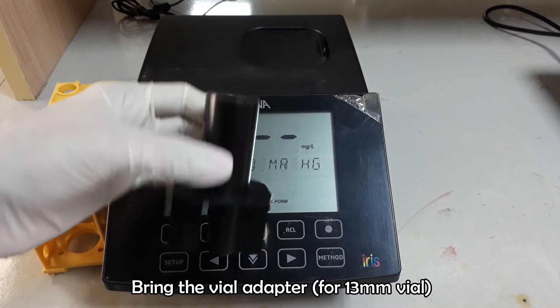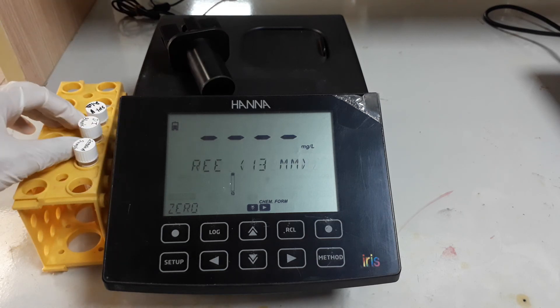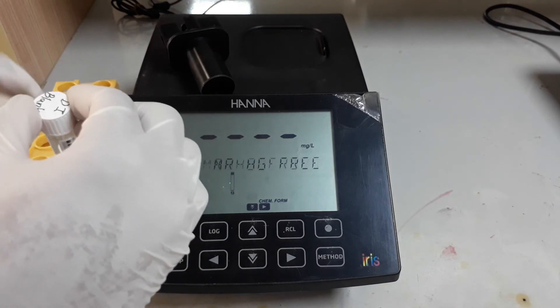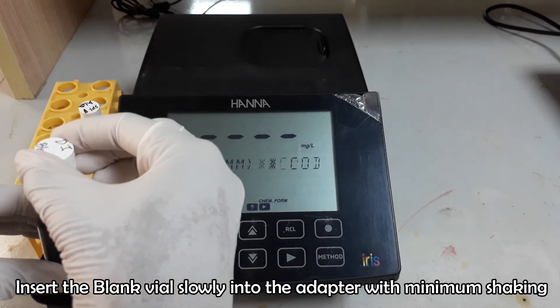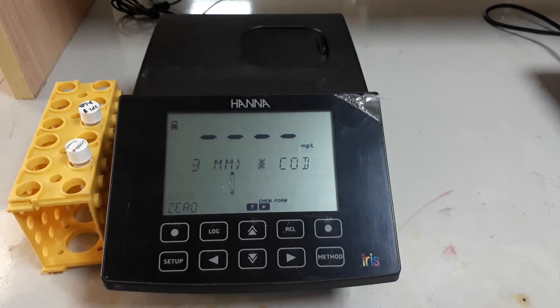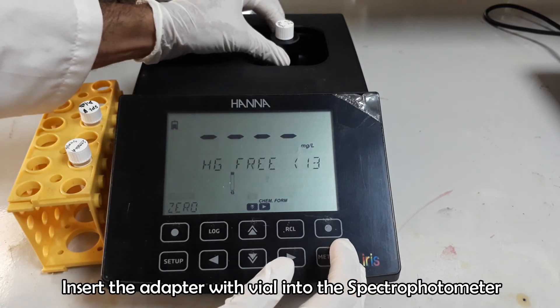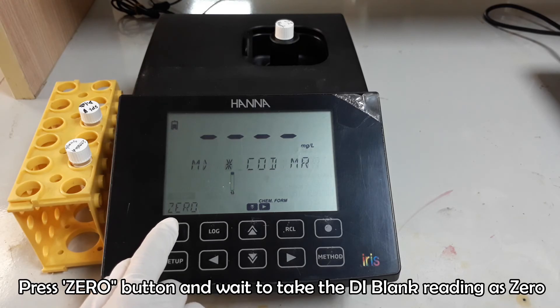In that case you will need different reagent vials named HI93754C. Bring the vial adapter for holding 13 millimeter vials. First insert the DI blank vial into the adapter and place it into the spectrophotometer. Press the 0 button and wait to set the blank at zero.